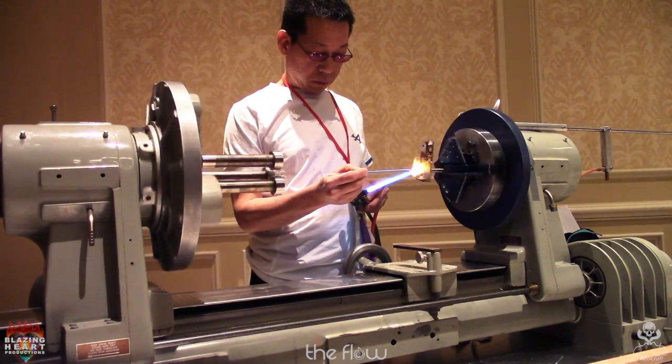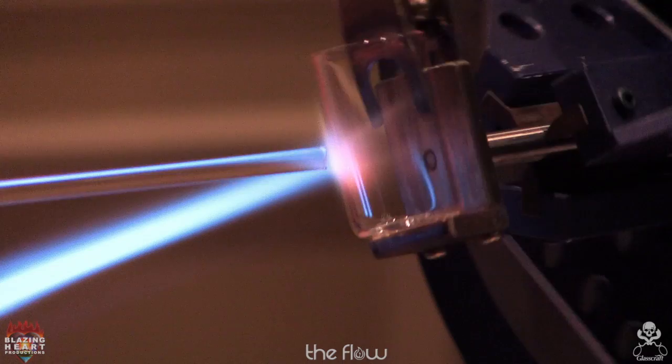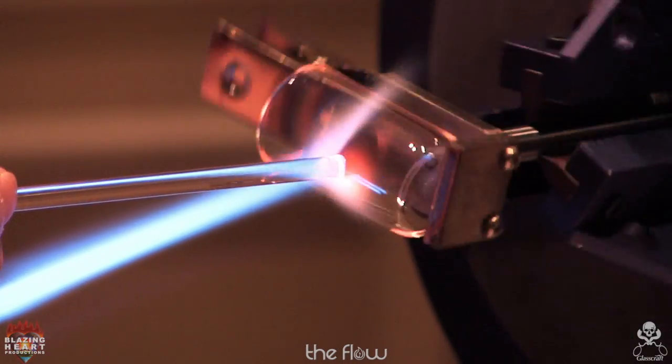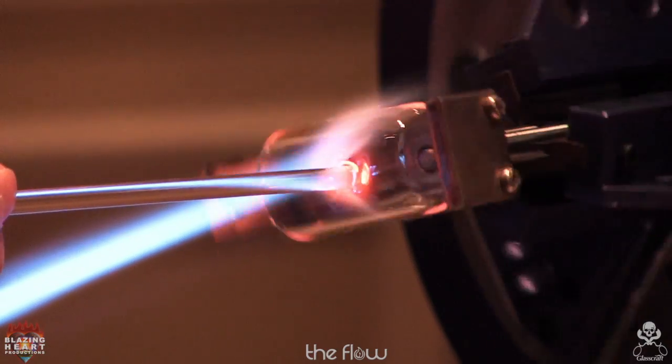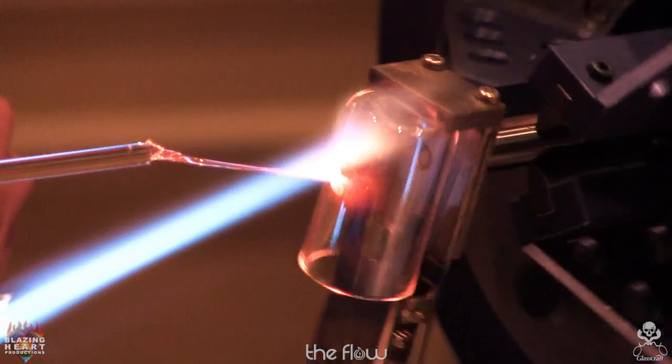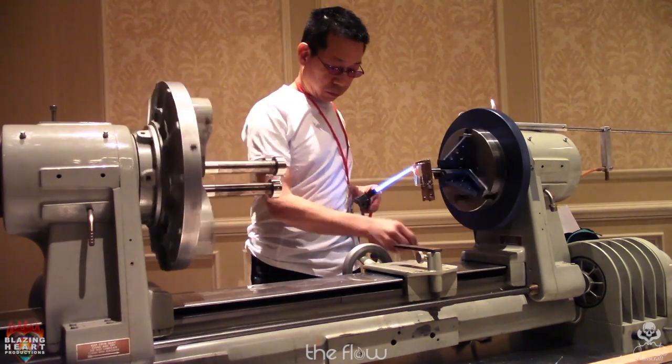So he's got a piece of 6 mil rod, and he's going to heat at the center of rotation. It doesn't need to get marked because of the fixture that he's got. If you're heating it, it's automatically going to pull open in the center.